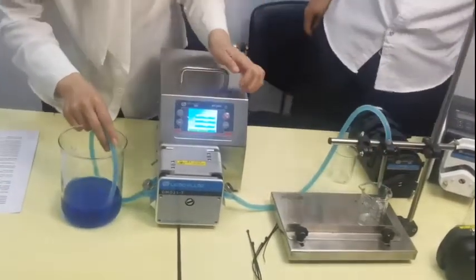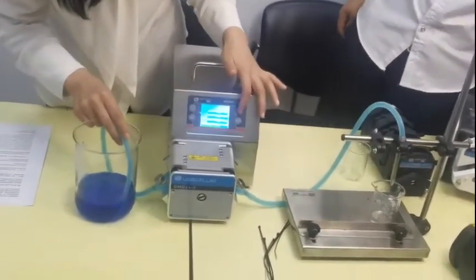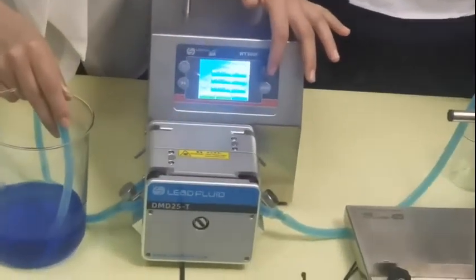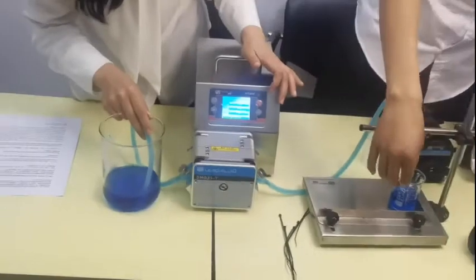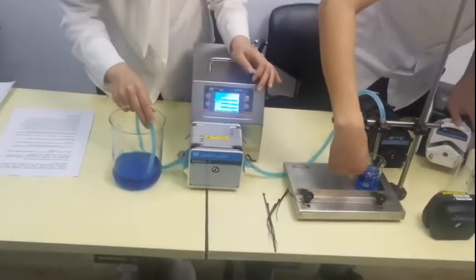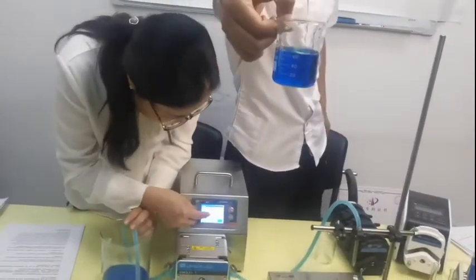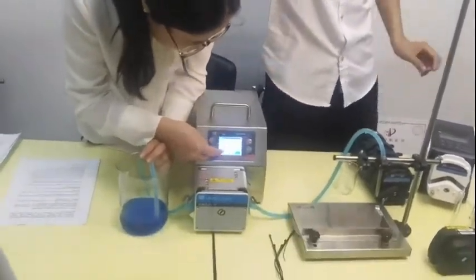Let's test the glass — the second one. We can try again. What's the volume? It's still 70. It's still 70? Yes. Okay, let's put 70 in.